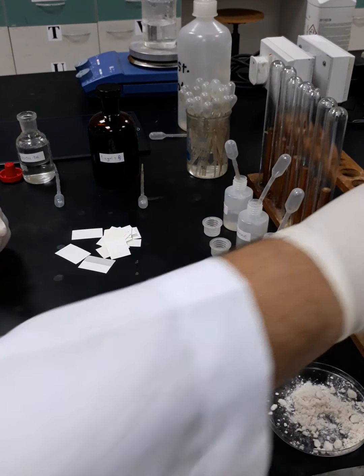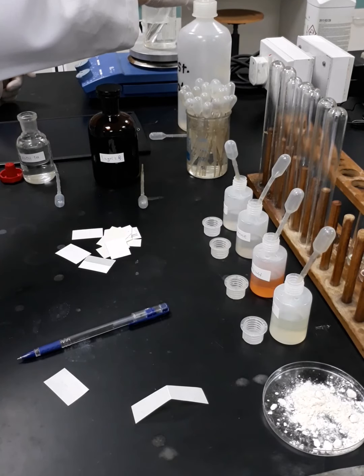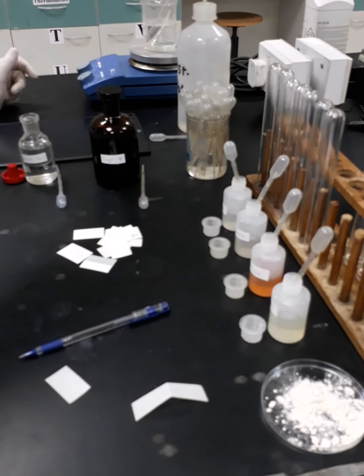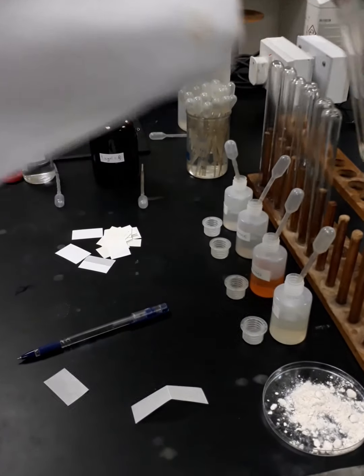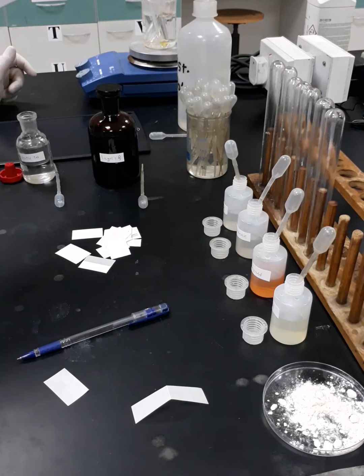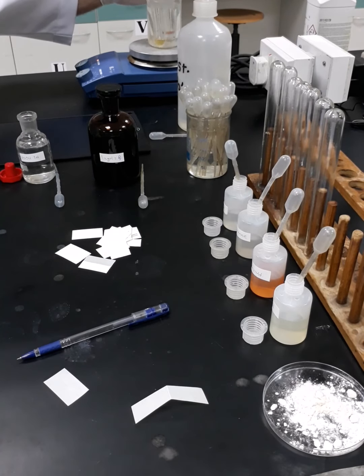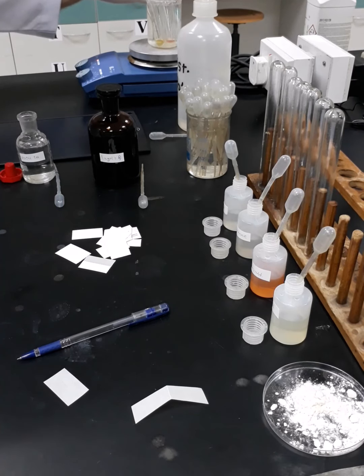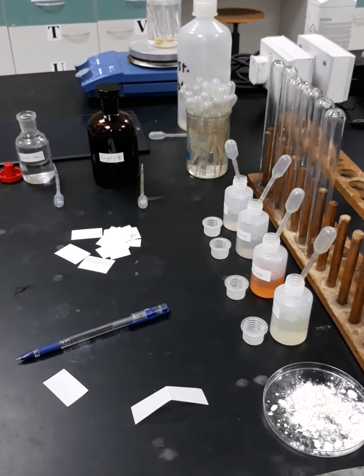So I'm going to put them inside the water bath at the same time for 1 minute. And I will start counting the time now.